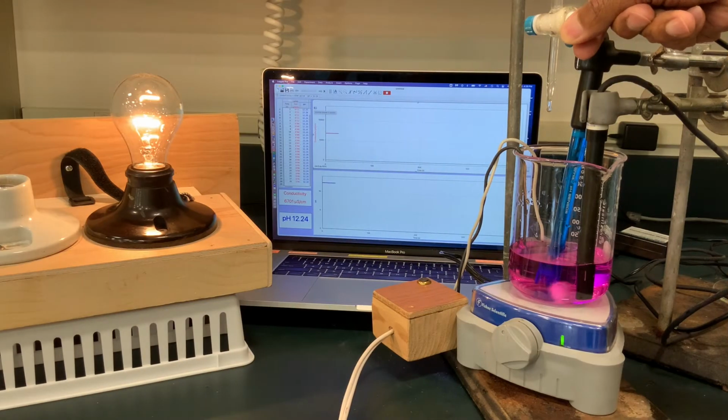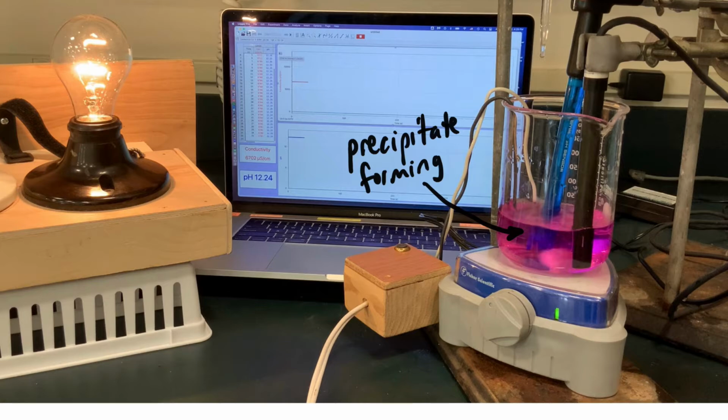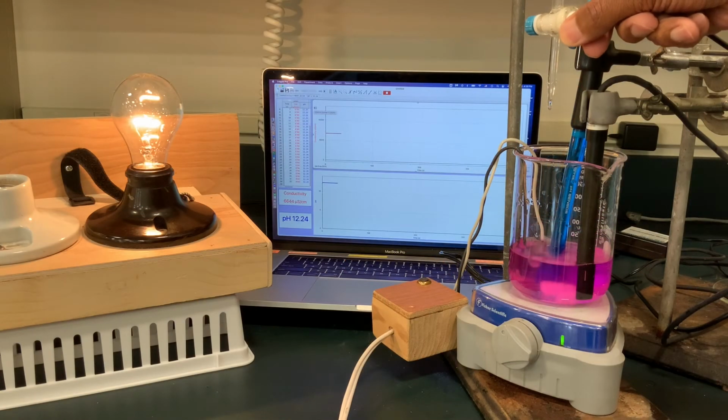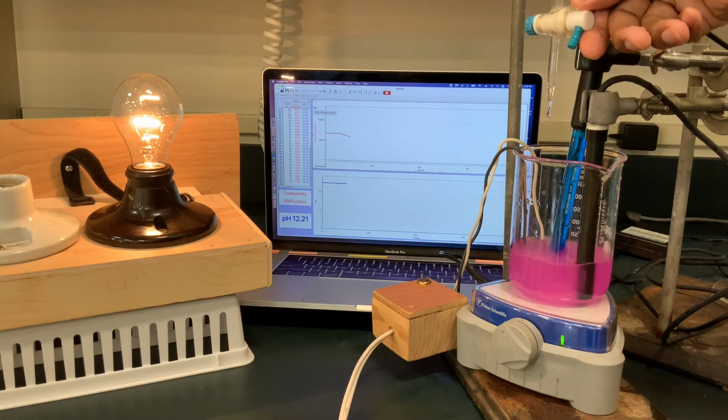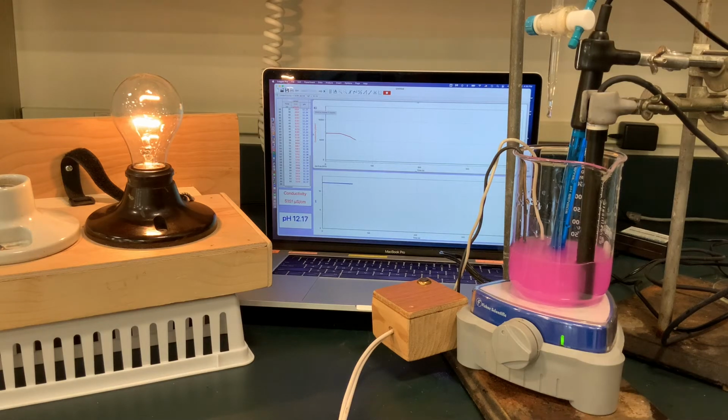And now notice, as the first drops of sulfuric acid enter the flask, precipitate will form. You can see them coming in drop by drop, slight cloudiness. And now I'll increase the speed of the video so we can move things along, and you'll want to keep your eye on the cloudiness of the solution, which contains phenolphthalein and is currently basic, which is why we see the pink.